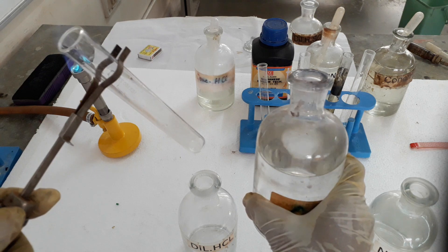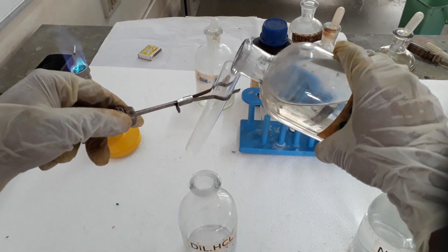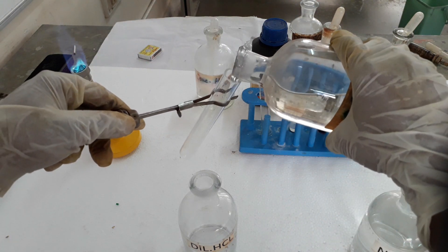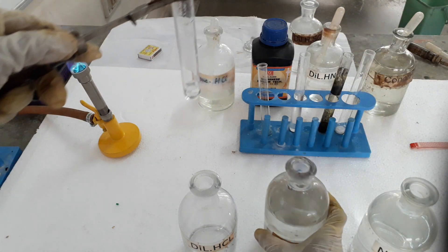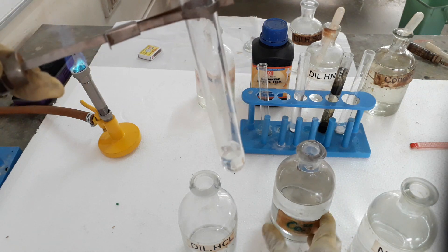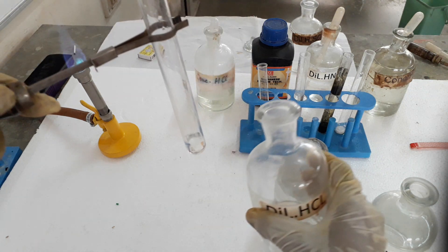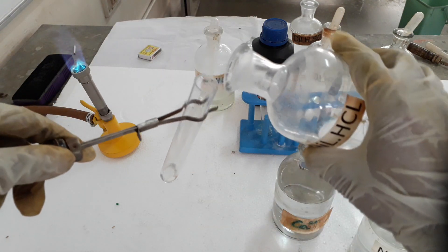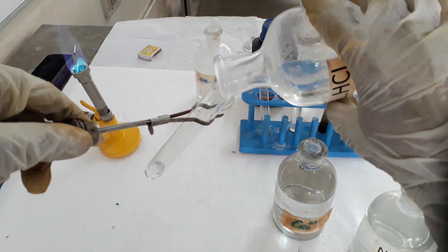I have taken silver nitrate over here. We will take a very little amount of silver nitrate solution in the test tube and then add dilute hydrochloric acid to it.